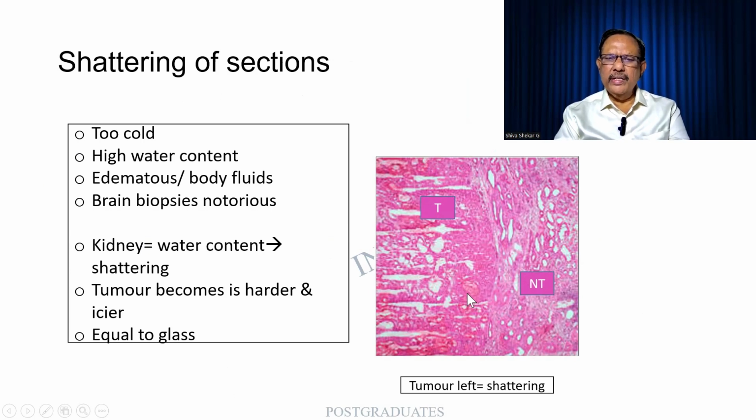Shattering of the sections. That is exactly what is happening over here. On this side, I am not able to see the details. Here, the renal tubule, etc., is normal. This is a carcinoma. So when it is too cold, the water content, edematous body fluids, and brain biopsy itself is notorious. That is why some people prefer squash preparations. Kidney for its water content, and the tumor becomes harder and icier. It is almost equal to a glass which cannot be cut.